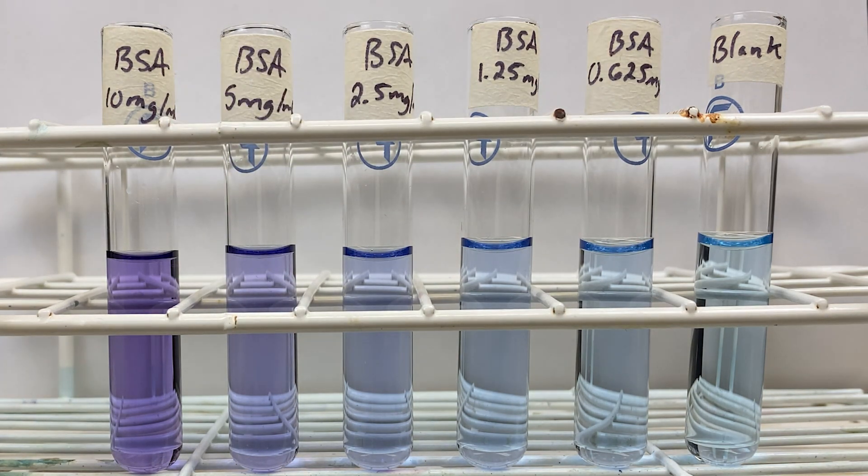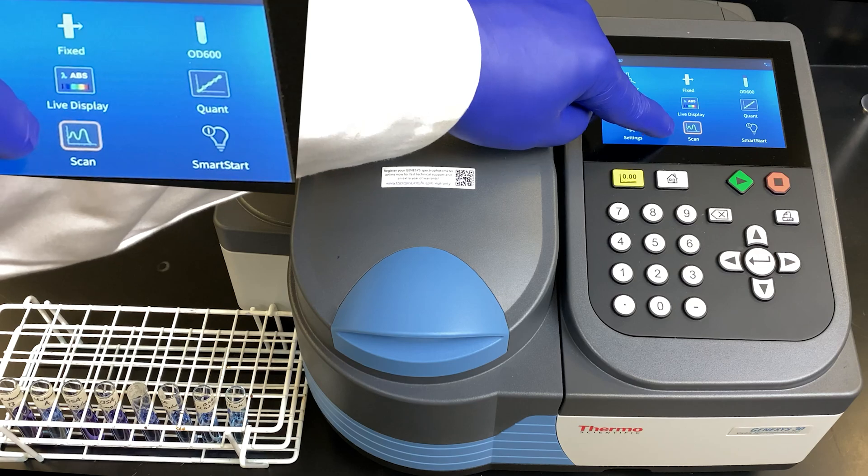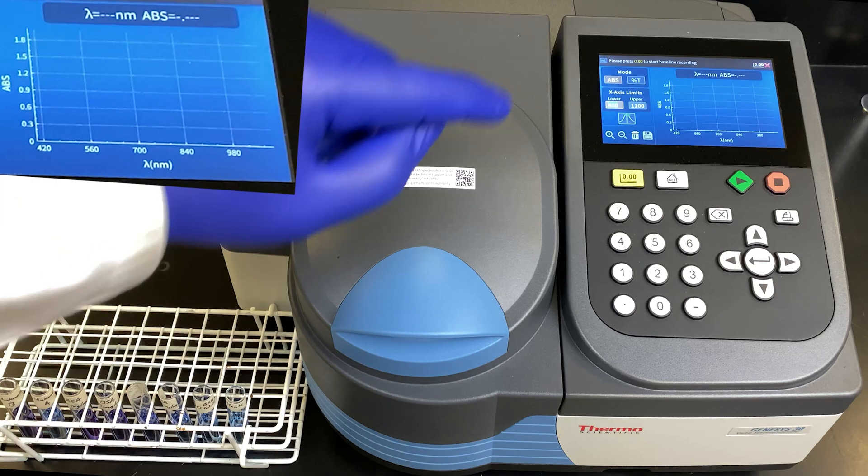The use of the spectrophotometer will allow us to determine what the actual absorbance is. We can do this quantitatively.